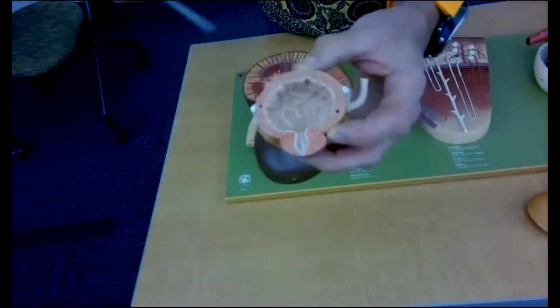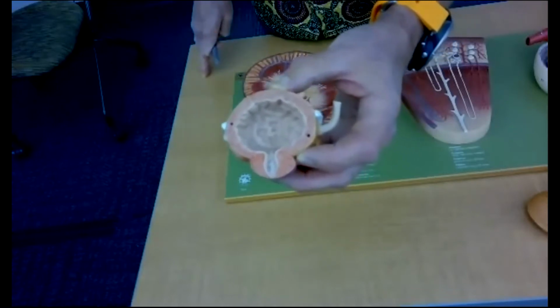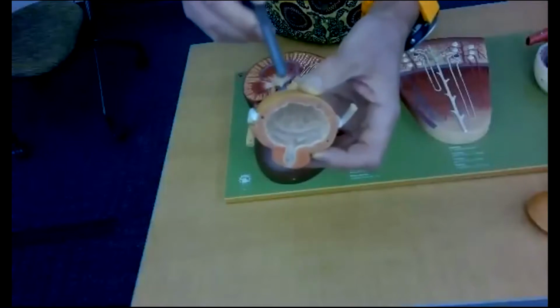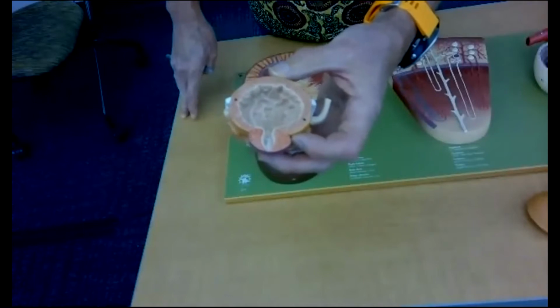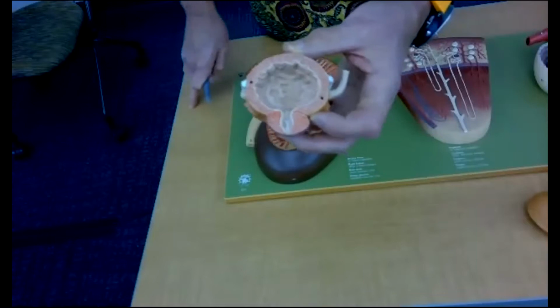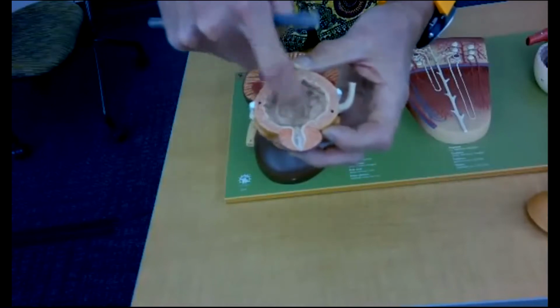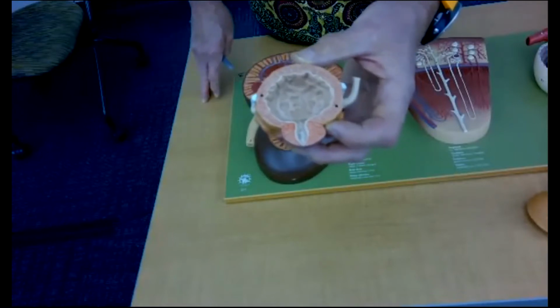The muscle on the outside is a smooth muscle called the detrusor muscle. The outside is covered by a connective tissue called the serosa. There's some connective tissue there too. And on the inside of the bladder, remember it's lined by transitional epithelium, and it's folded into rugae in an empty bladder, because the epithelium is stratified when it's empty.